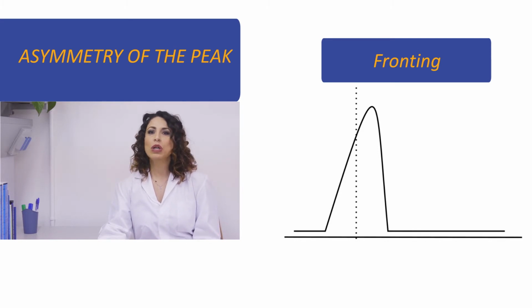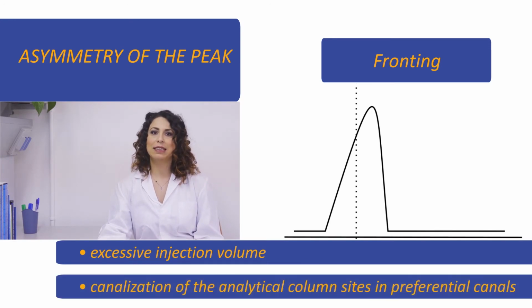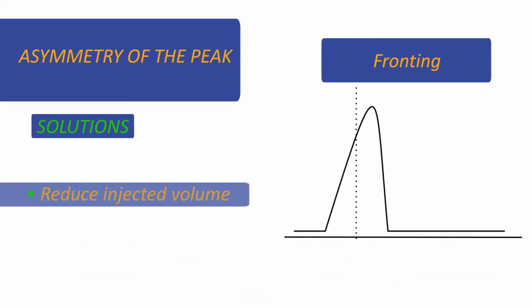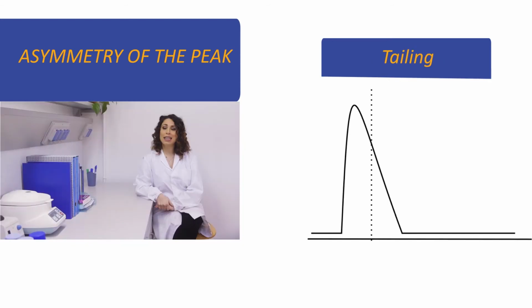It can be caused by excessive injection volume or channeling of the analytical column in preferential channels. In such cases, a reduction in the volume of the injected sample is necessary and/or washing the column. As a last resort, the column can be substituted. In tailing, the second part of the peak is less steep than the first half.